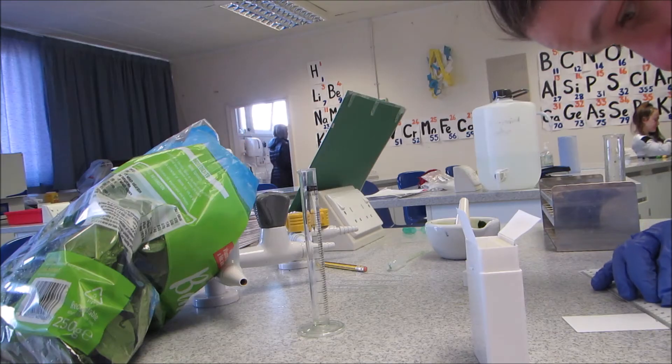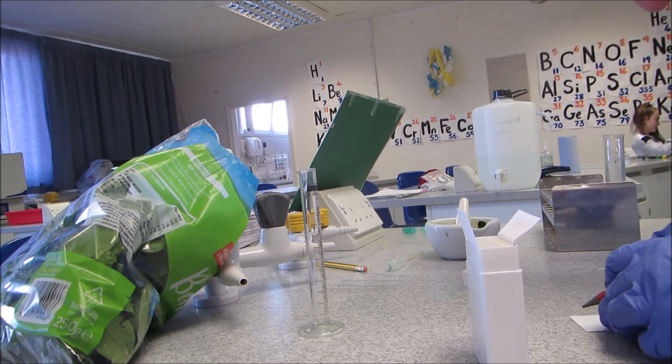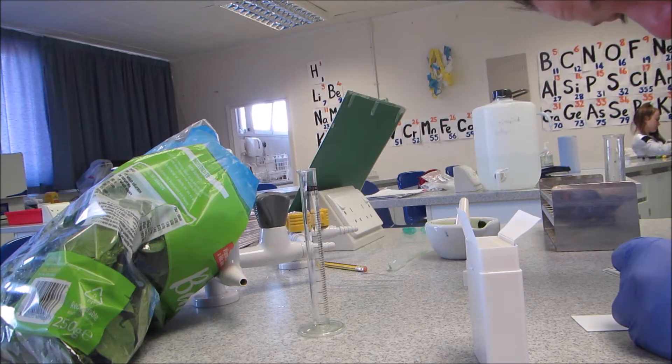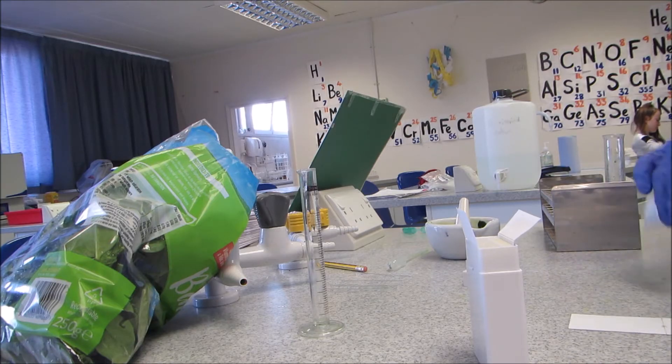Don't stretch, be quite gentle with a pencil, you can break a hole in it. And in the middle of that, I'm just going to draw an X where ultimately I'm going to spot my solution.